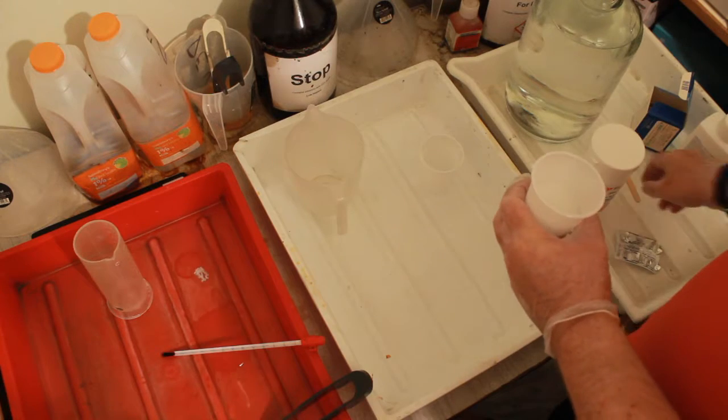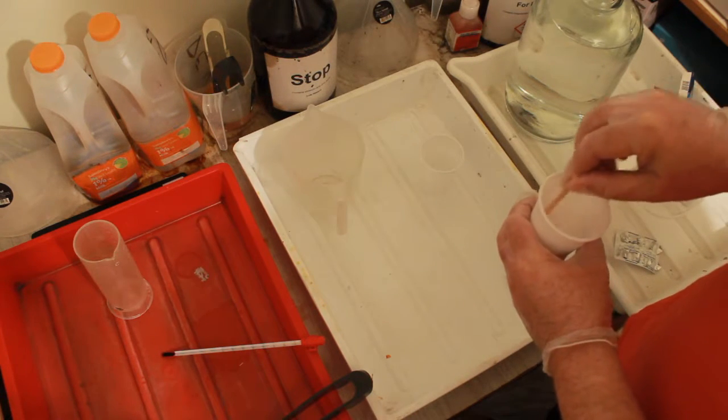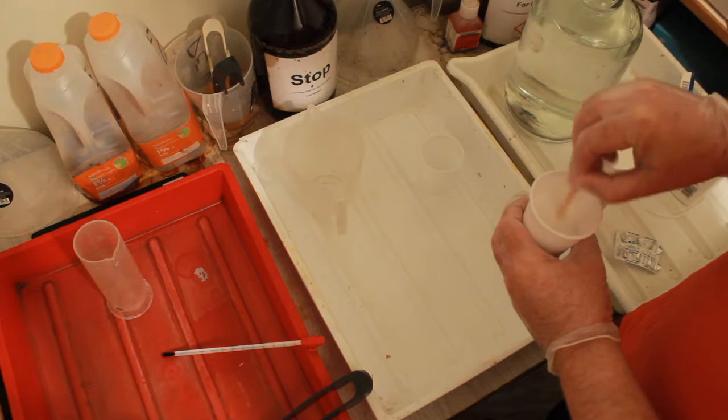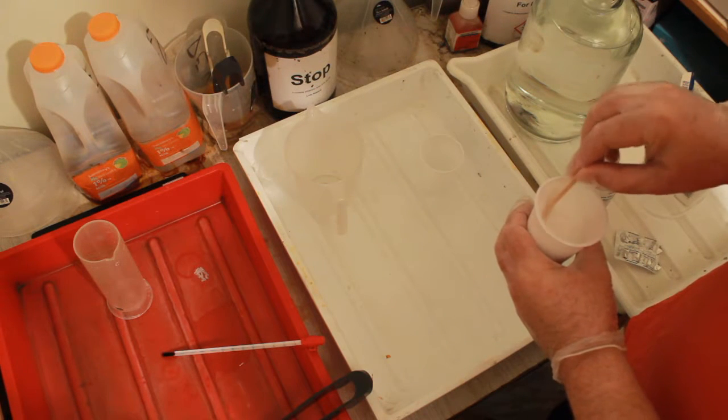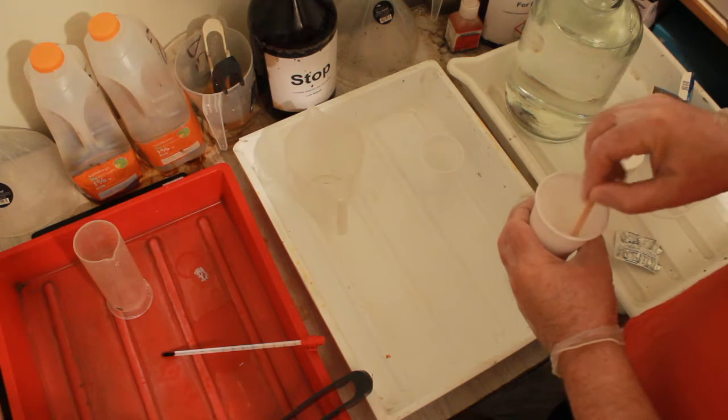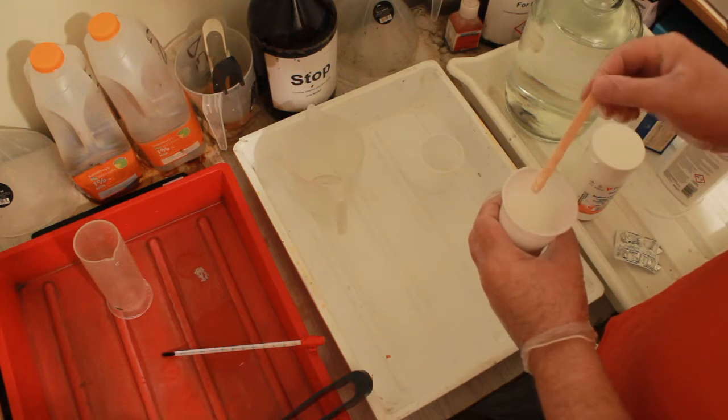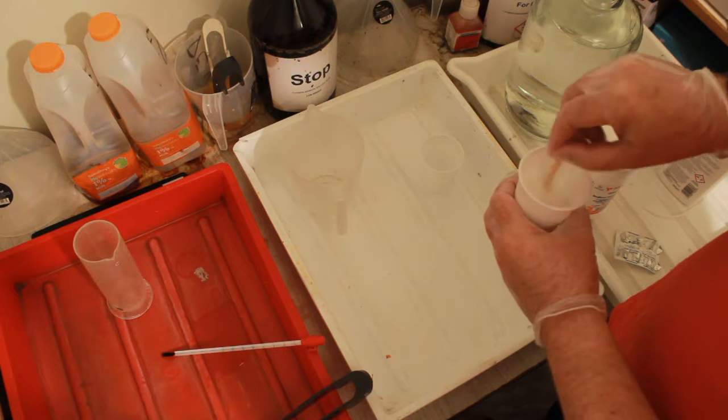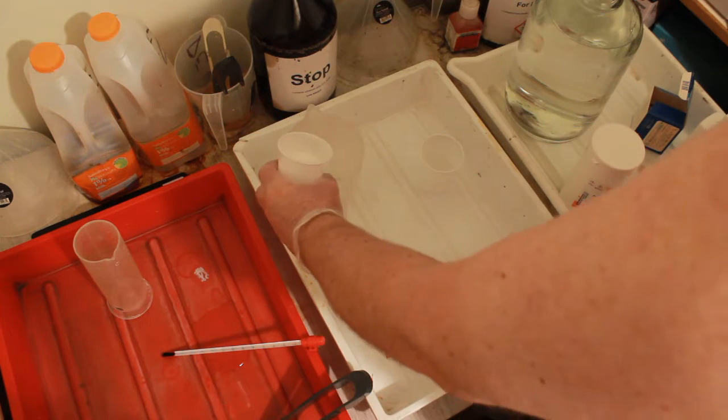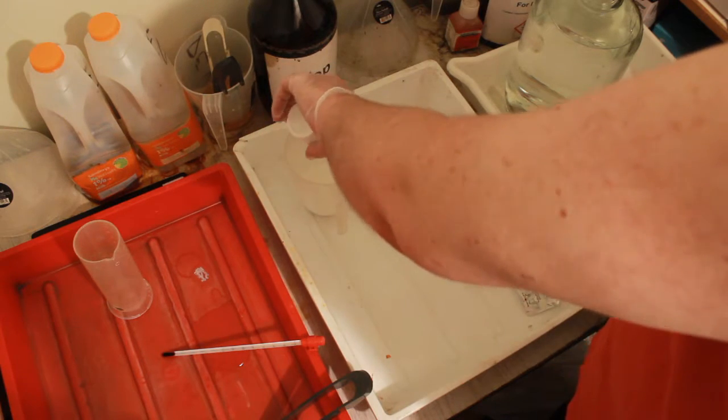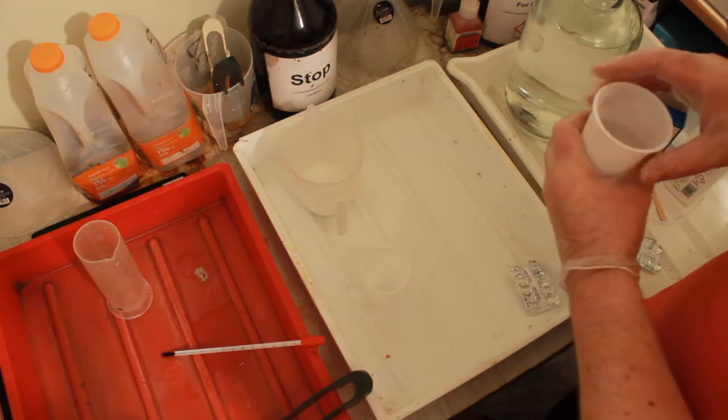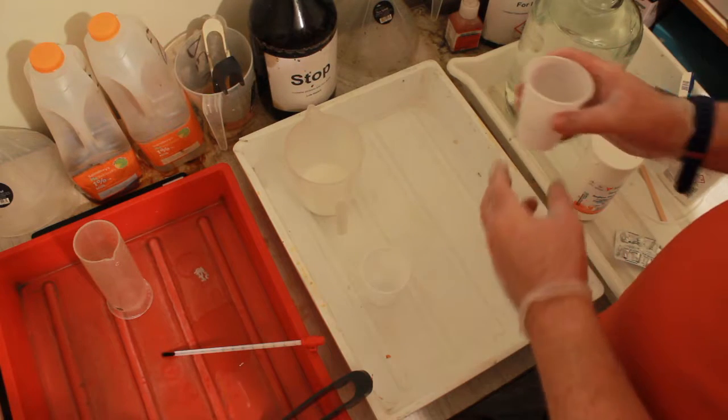We can guess that that is pretty well dissolved. This one that contains the metabisulfite and the paracetamol isn't, so we're going to give that a good stir. This is actually quite cold. I'm going to pour it into there. It's come out quite clean. And this one - it's really quite hot. We're going to pour into there also. Actually we shouldn't do it when it's that hot.